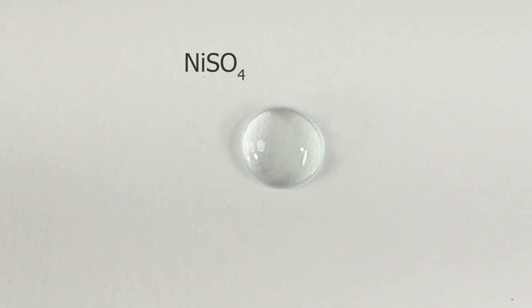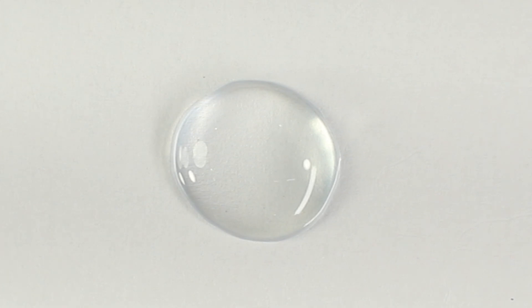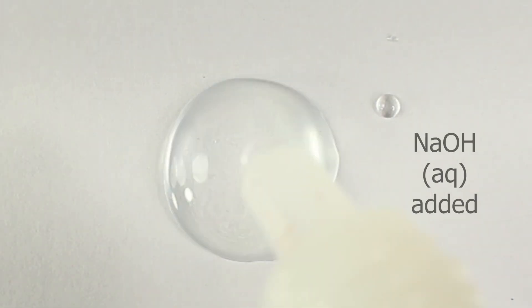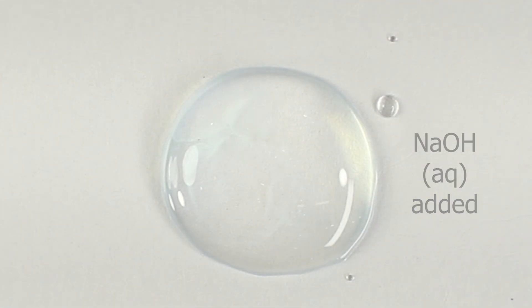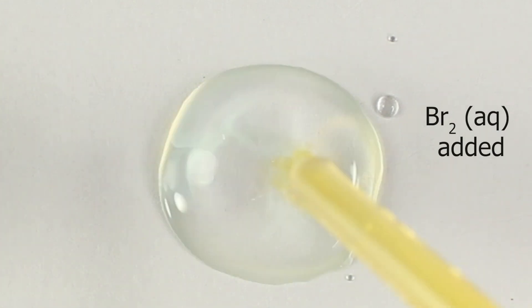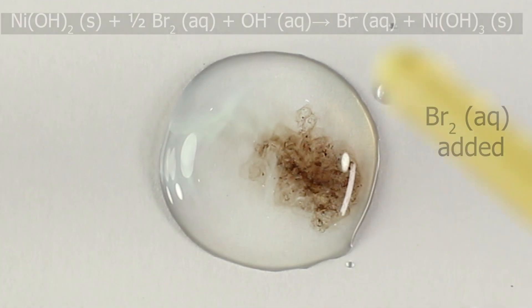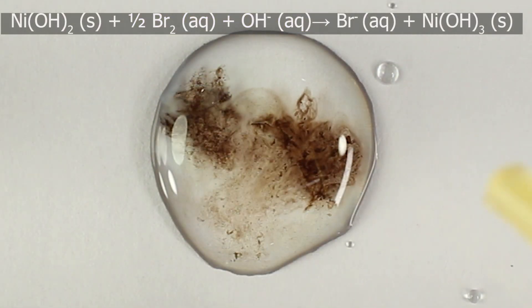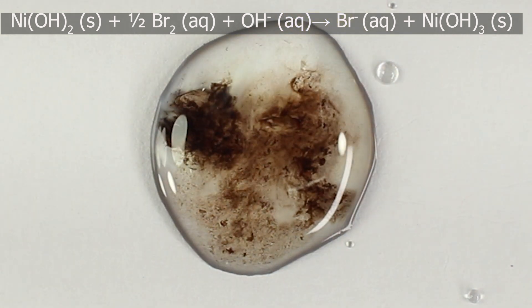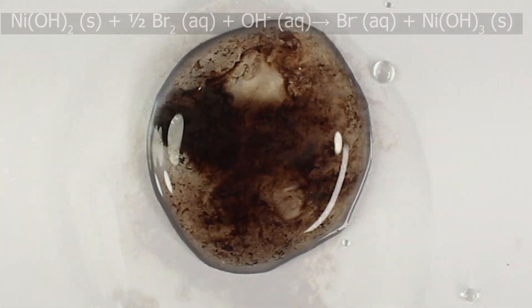Let's run it on the microscale. Again, I need low concentration for this to work. The nickel-2-hydroxide precipitate is hardly visible, but we can develop it very well with bromine water. Black precipitate formation confirms the presence of nickel-2. The equation above tells us what's going on: bromine molecules oxidize nickel-2 ions into nickel-3, and themselves change from bromine molecules to bromide ions.